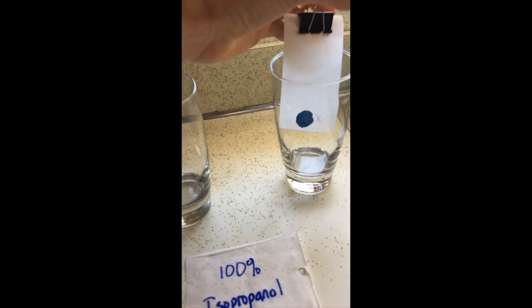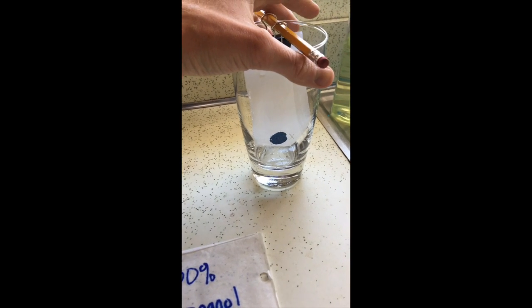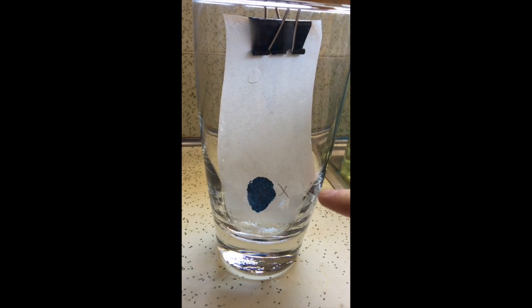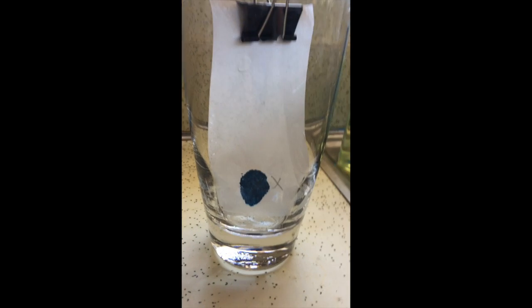And then all you do is just put in your paper, and the goal is to get it to just touch the solvent, which is that isopropanol, but not stick the dotted substance in there. So I'm trying to see if it's touching or not. There we go. And I forgot to fold my corners. That's probably going to influence it. But that's how you do it. And then the solvent runs up, and it will move the components based on polarity, and we'll see if it has any different components more than just blue.